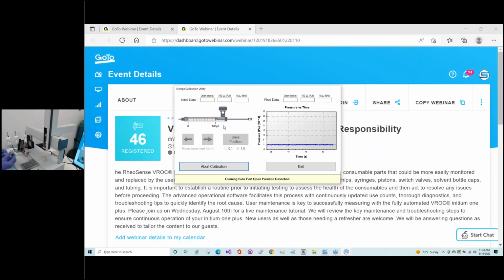And so it's probably a little difficult to see here, but there's a white portion of the piston at the end of the rod. It's the tip of that you want to hit the 100 microliter mark on the test syringe.